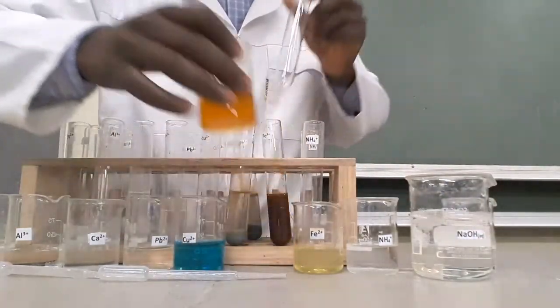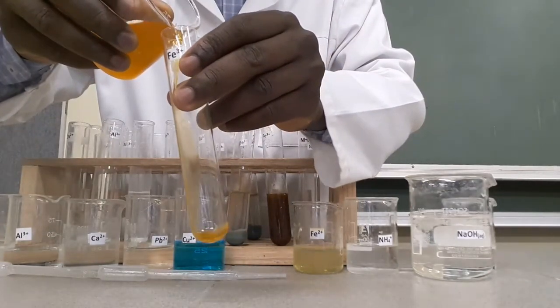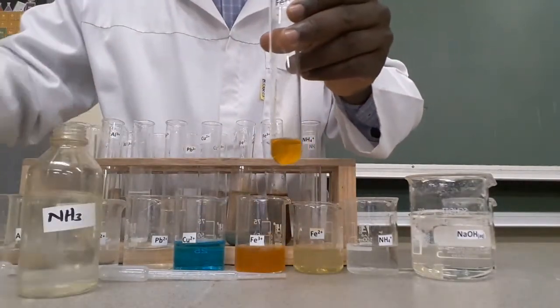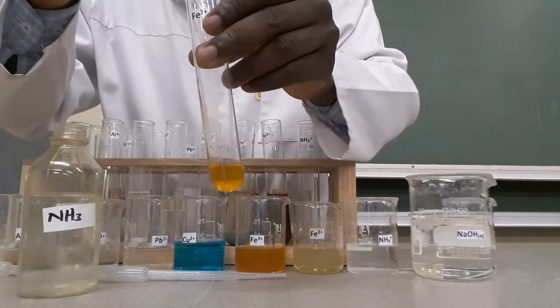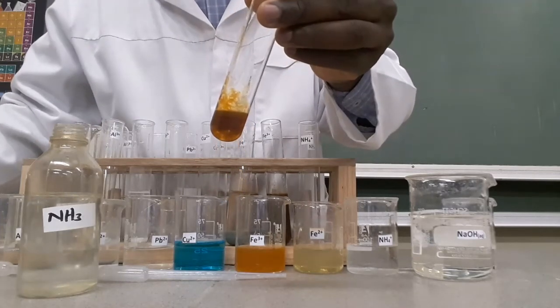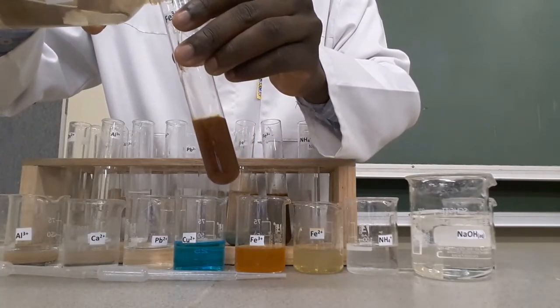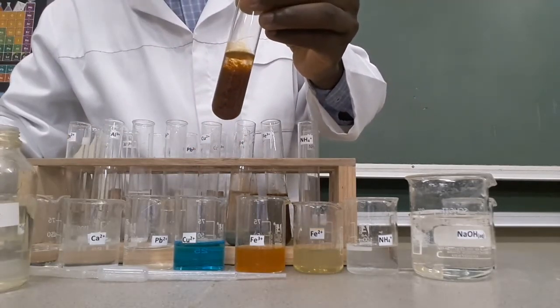Let's take a fresh sample of solution containing Iron-3 to see the effect of aqueous ammonia on Iron-3 in solution. Add a few drops of aqueous ammonia — a brick red precipitate forms. Adding excess ammonia, the precipitate of Iron-3 is insoluble in excess aqueous ammonia.